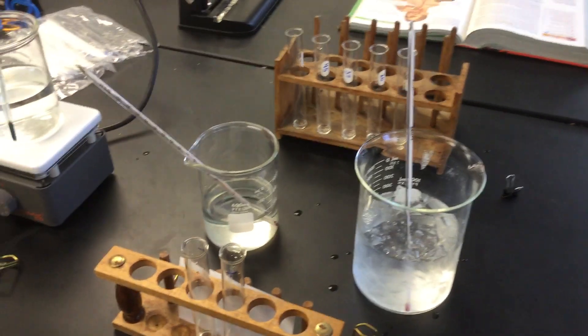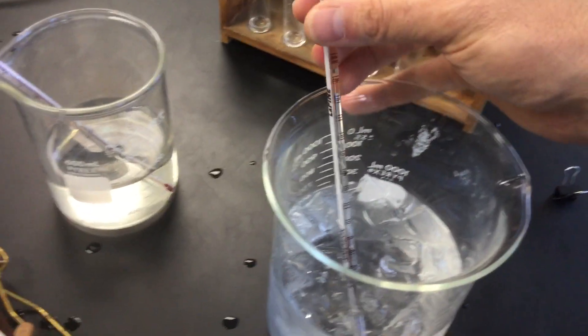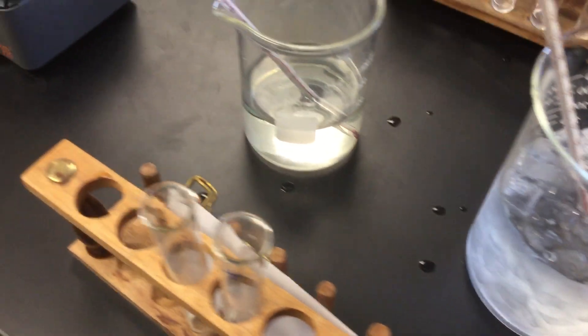So as you see here, I have different temperature setups. I have cold, which is approximately 3 degrees Celsius. This one is room temperature, which is 20 degrees Celsius.